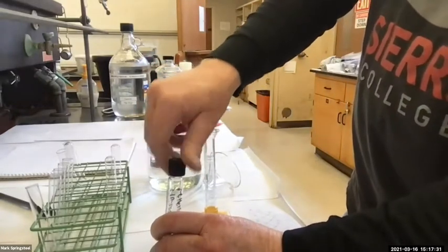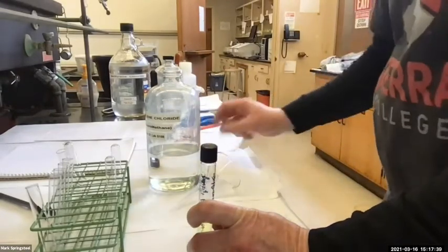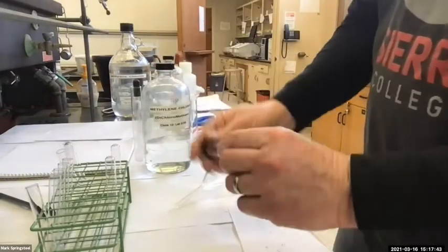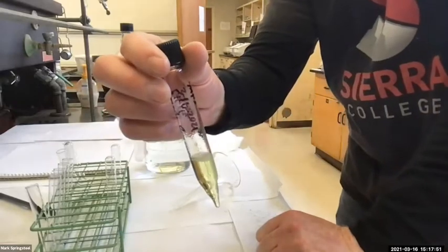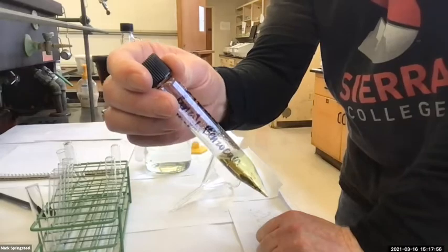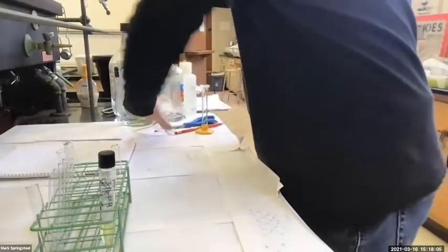So I'll cap it and invert it, kind of shake it up so I can get all that. But I'm going to be careful because I checked this for leaks with water, but sometimes the organic solvents will leak even though the water wouldn't, because they're a little thinner. But it's looking pretty good. Yeah, I like it. I think everything's dissolved. What do you guys think? Pretty good, right? Your resolution looks good on my end, probably better than ours. So you'll have to trust me on this one.